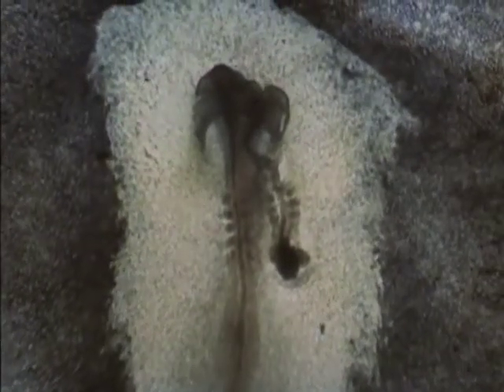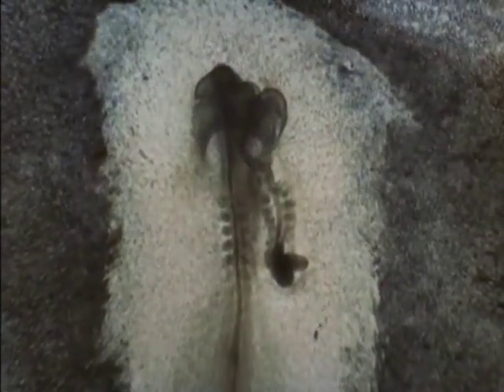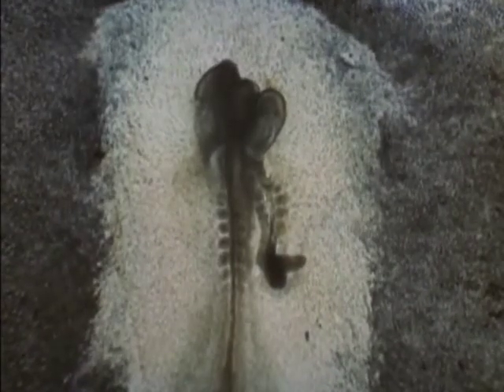Now let us observe the primitive node, which functions as an organizer to develop various forms and organs of the embryo in the chaotic sea of cells. The dark spot on the blastodisc is a primitive node grafted from another blastodisc. It brings forth another embryo in addition to the one proper to this blastodisc. This clearly indicates the importance of the primitive node upon the organization.